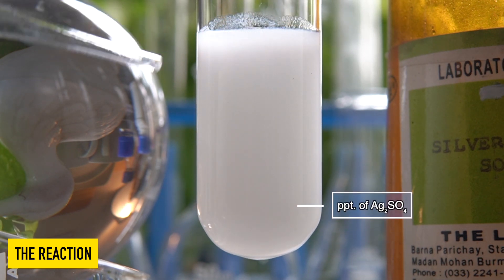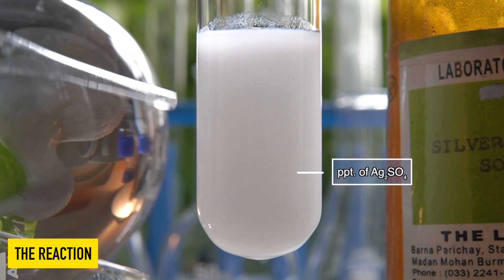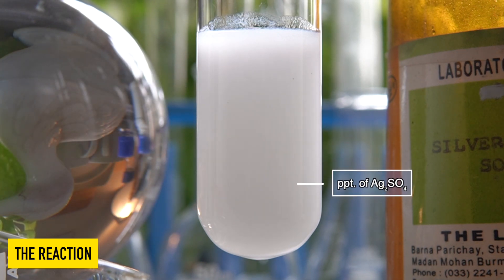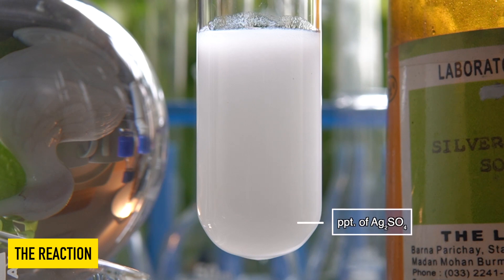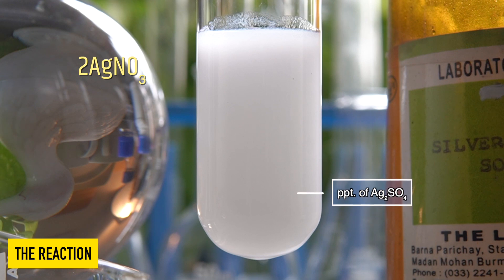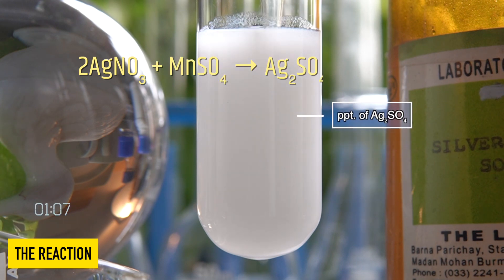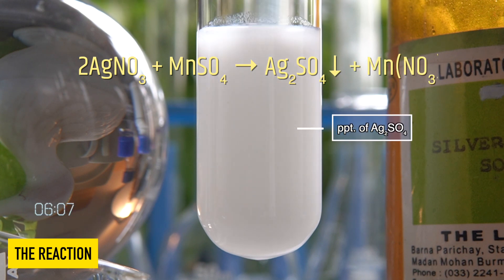The insoluble white precipitate that has been formed inside the test tube is nothing but silver sulfate. So in this reaction, silver nitrate reacts with manganese(II) sulfate to produce a white precipitate of silver sulfate along with manganese(II) nitrate.